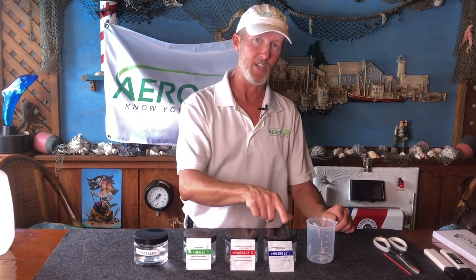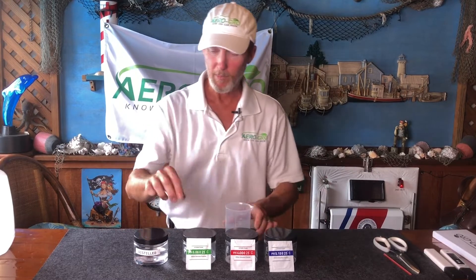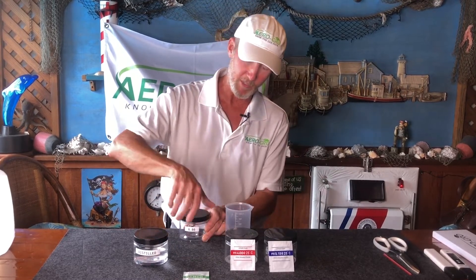The first step is to mix up our three containers of buffer solution. There's a very specific order: normally people are tempted to go in numerical order — four, six, nine — but we don't do that. When calibrating, we start with the six, then the four, then the nine. That's very important because your meter is set up to test in that way. Physically line them up in this order every time so you can't go wrong.